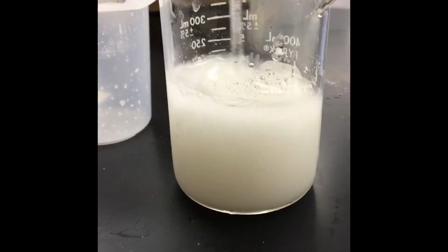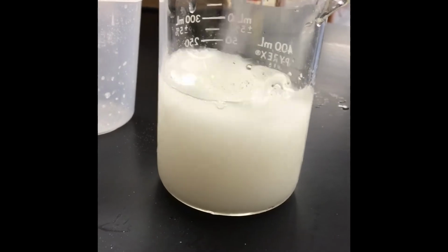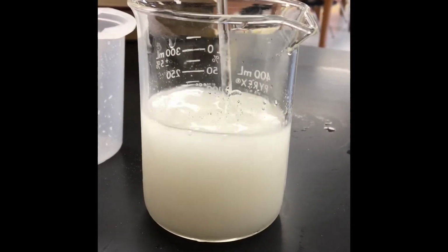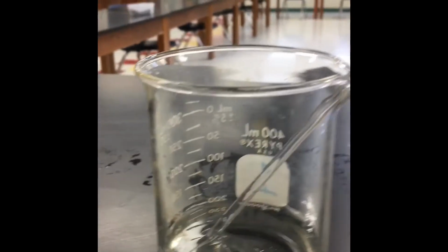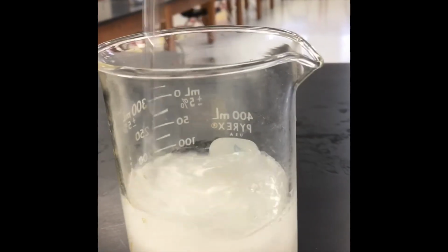So I'm going to repeat this process for my other 2 beakers. This was the 180 grams of sugar added to my cold water beaker, and you should have that temperature already. Alrighty, and now let's do the 200 grams. So this is going into my room temperature water.